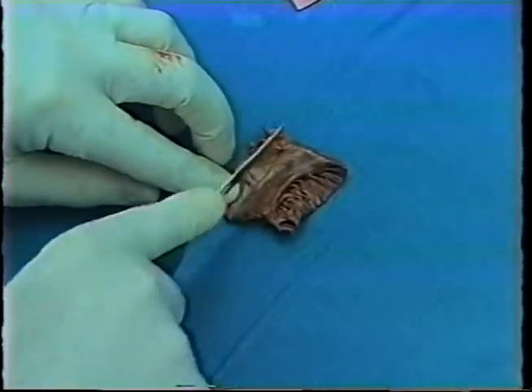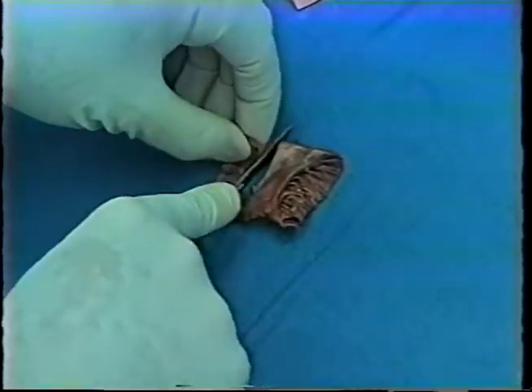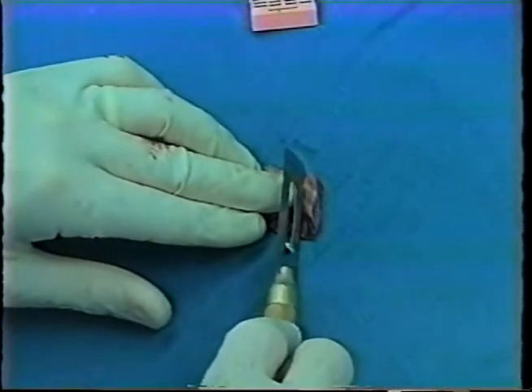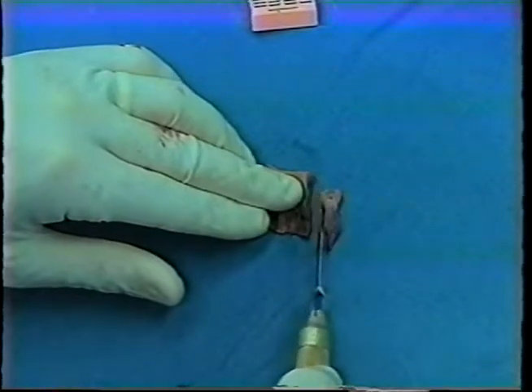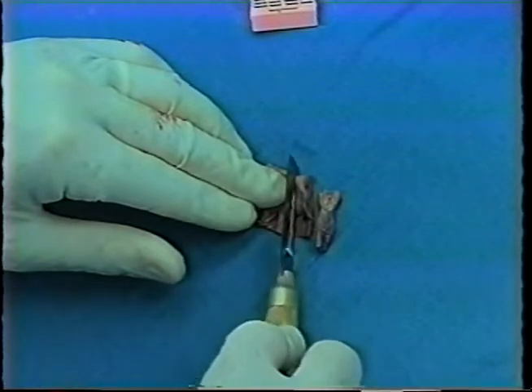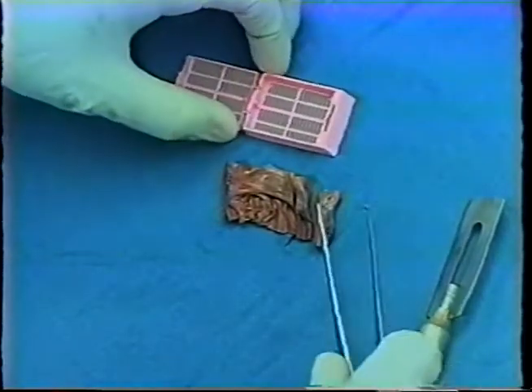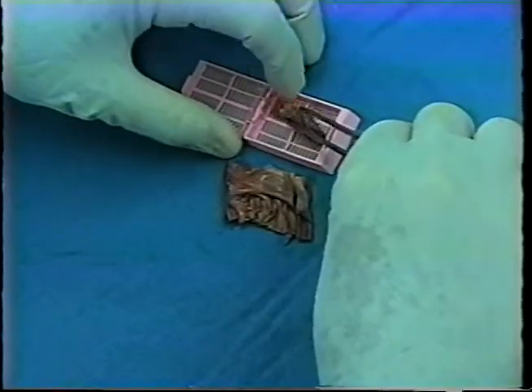And we'll do that with a regular scalpel knife. And we simply make parallel cuts beginning at one end. We lay the pieces on their side, and if we put the side down that we have just cut, and by way of example, I will show that we will lay these two pieces in a cassette.